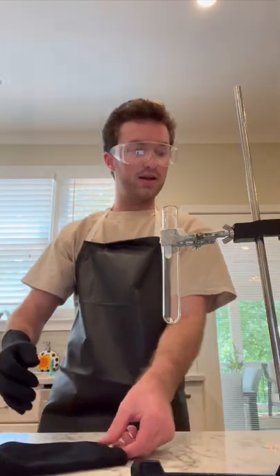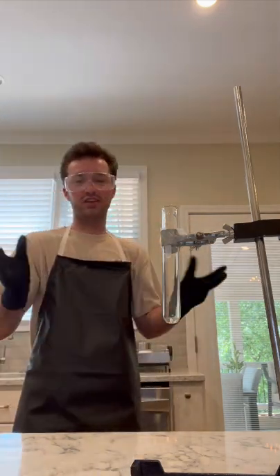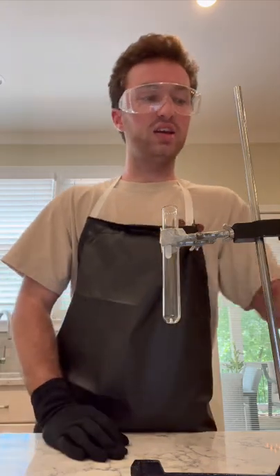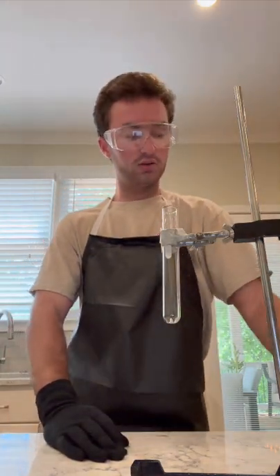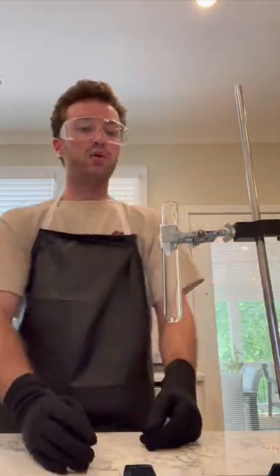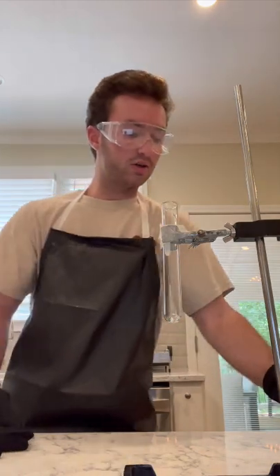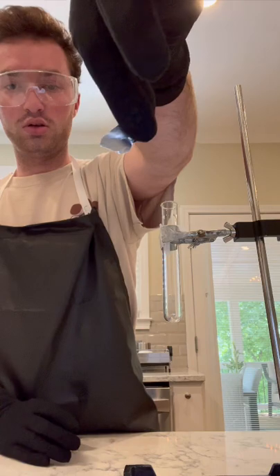All right, so I am back for my part 3 reaction. This is the reaction I didn't really need much of a setup or preparation for. Just need to get my aluminum foil and my hydrochloric acid. So for starters, just to save some time, I went ahead and crumbled up a 2x2 piece of aluminum foil, just to show you. Here's another one. That's the size it was.